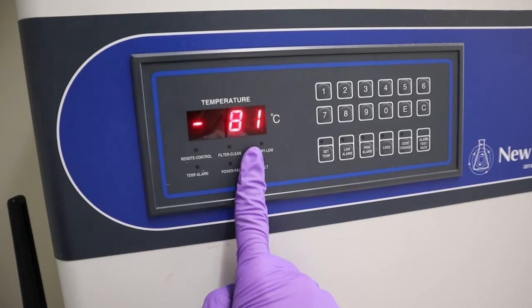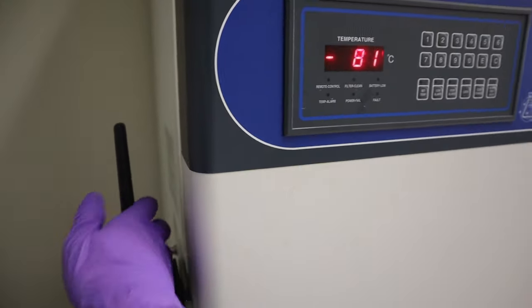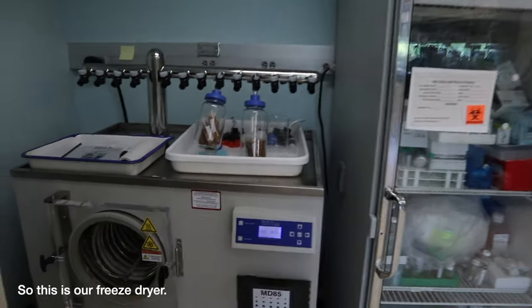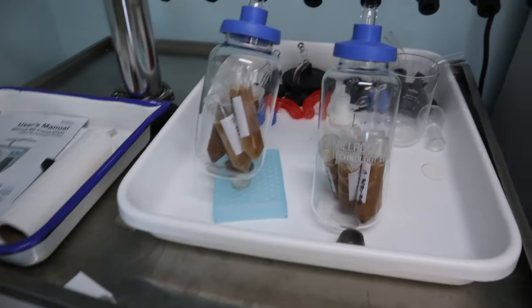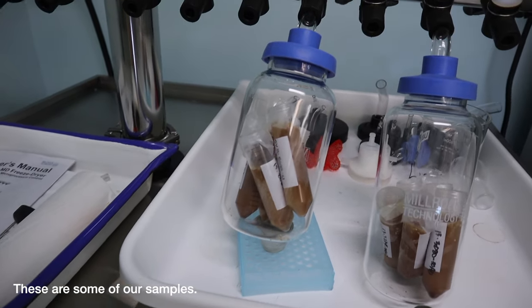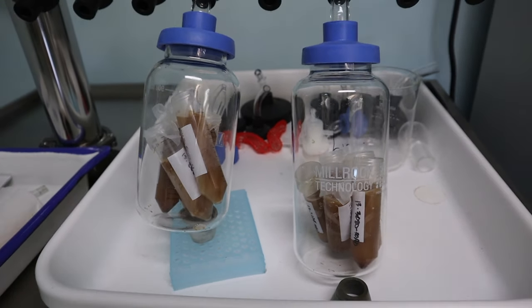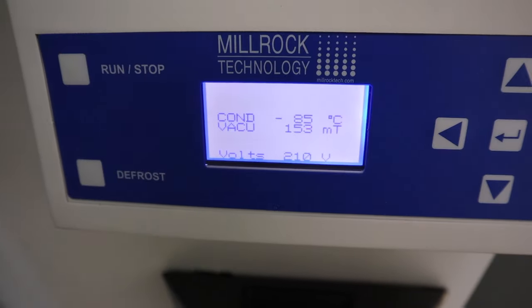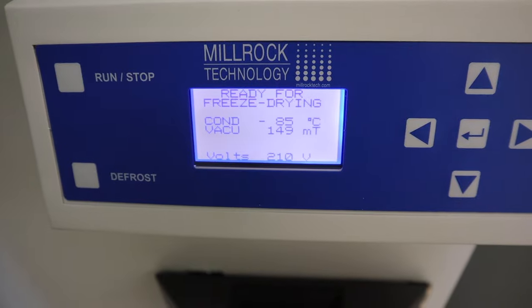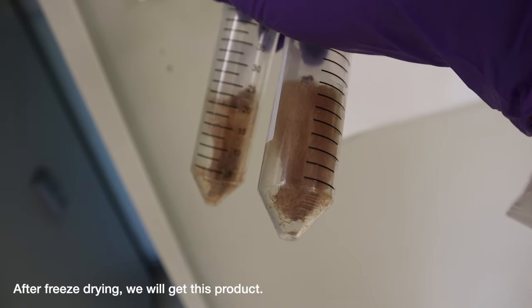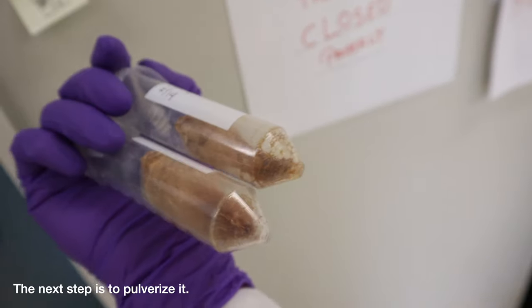After freezing for about a day, it's negative 80. After freezing it, we load it in a freeze dryer. After freeze drying, you will have this product.